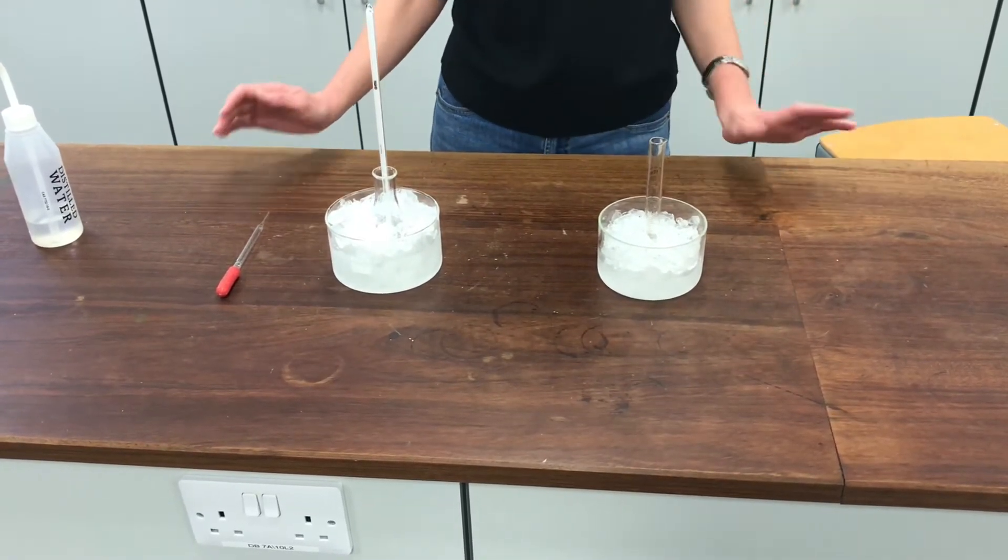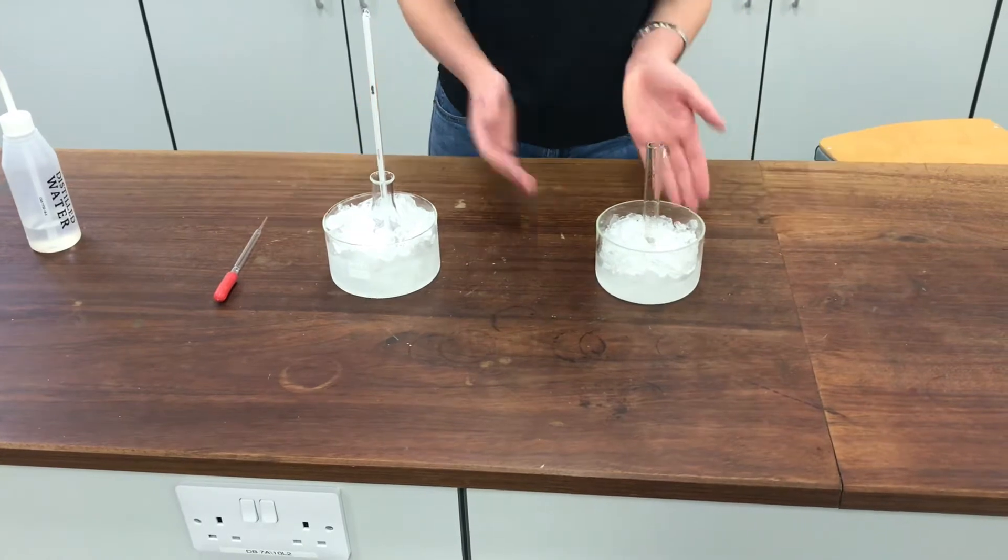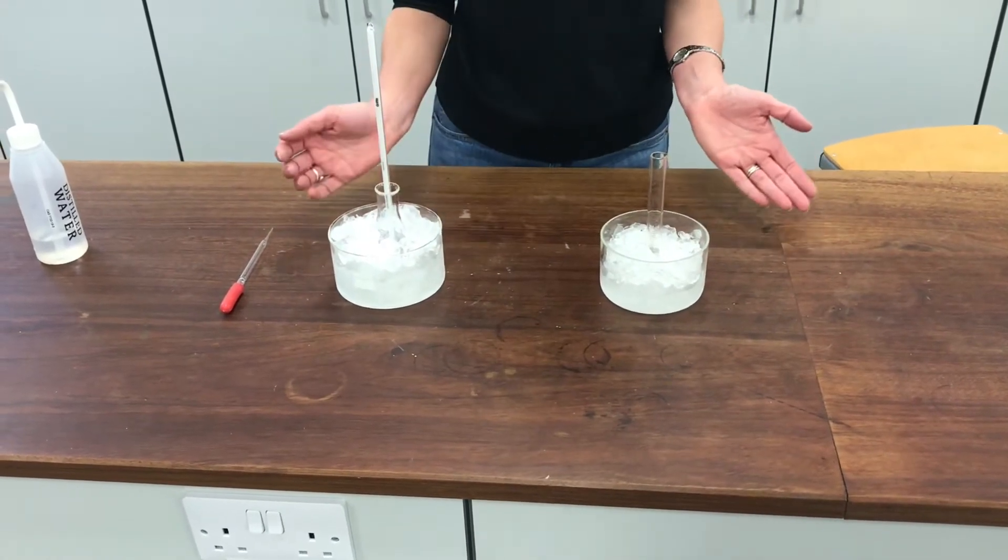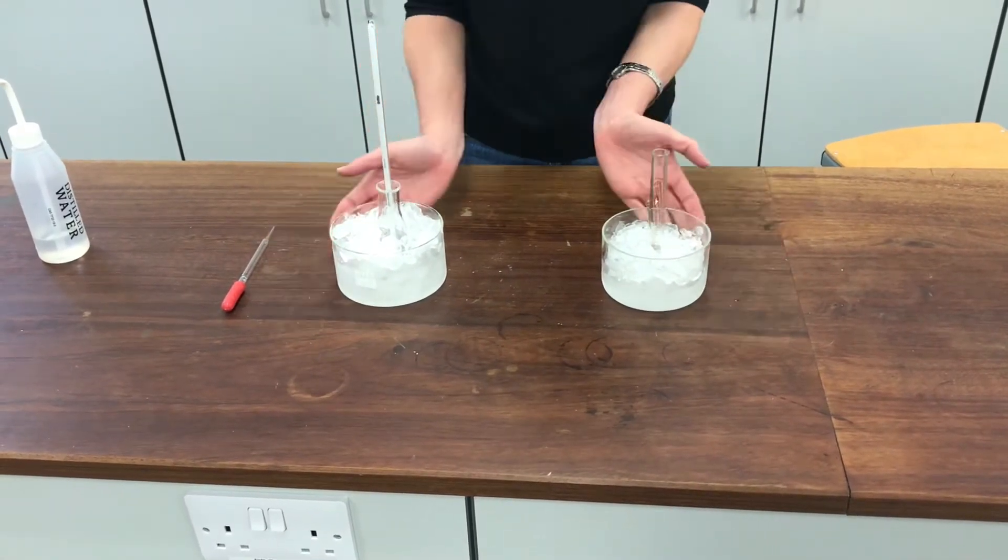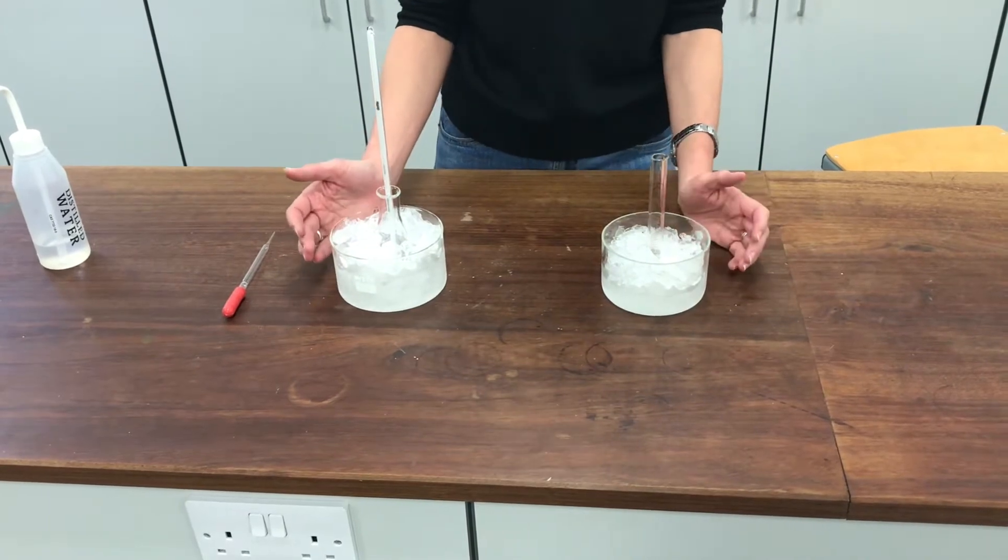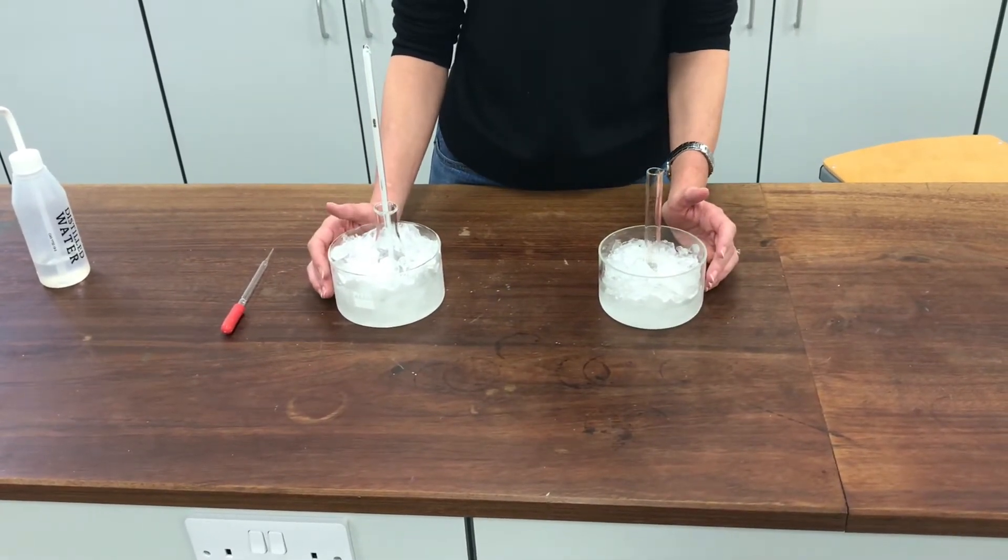So I've taken some steps to make sure that doesn't happen. One of them, as you can see here, is I'm keeping everything extremely cold. I've got really good ice baths here and I put salt on them as well so that I can keep the temperature as low as I possibly can.